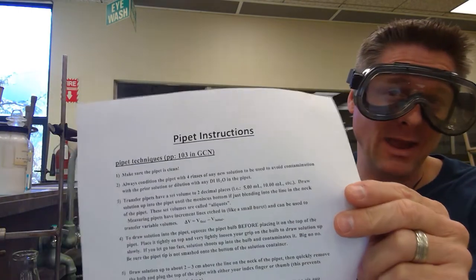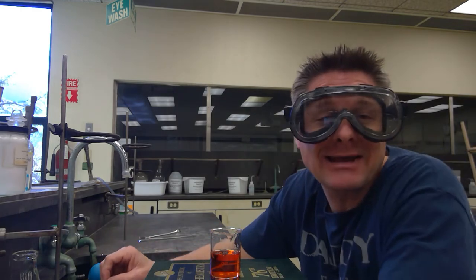Hello, Chem 185 team or whoever's watching this. We're going to be looking at pipettes — pipette instructions. We did not use these in first semester general chemistry at Orange Coast College, but we will be for several experiments for Chem 185. It's definitely something we want to get the technique down, and it's one of the skills we want you to learn because there are two unknowns that are going to be directly dependent on your pipetting skills.